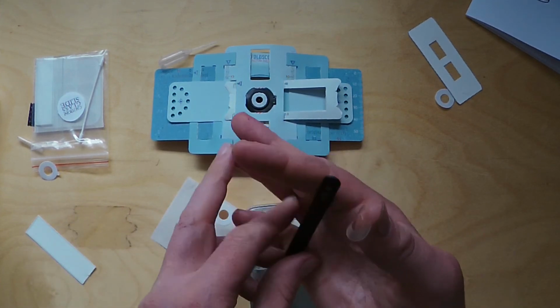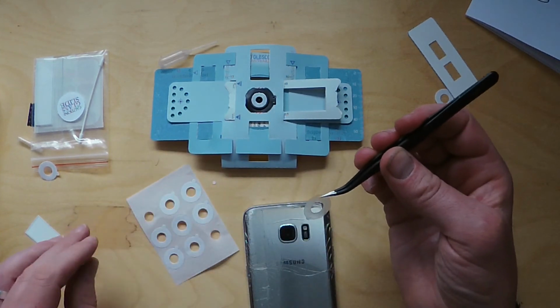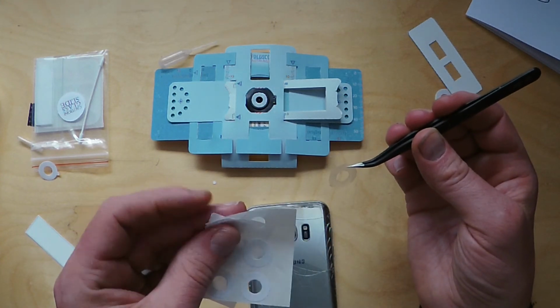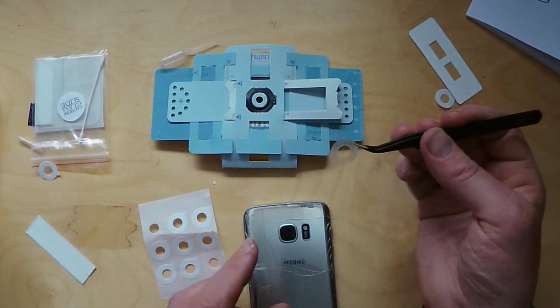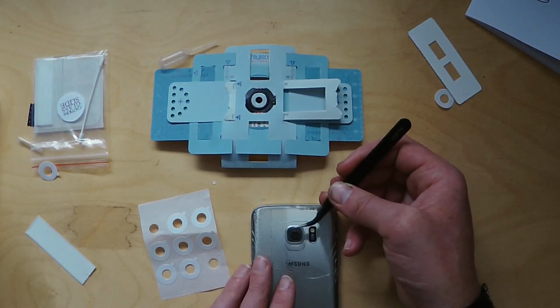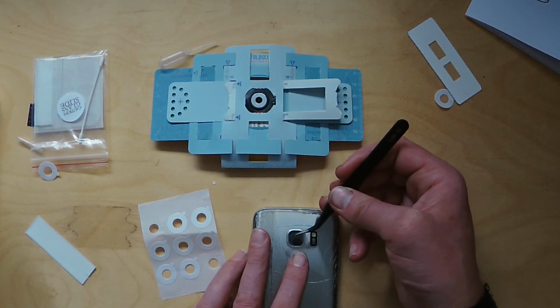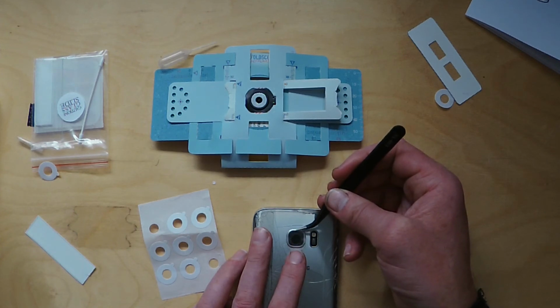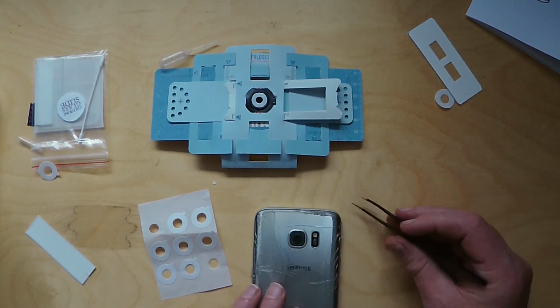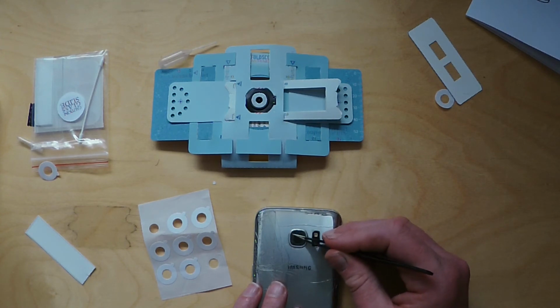Yeah, so obviously you need to take care when removing that sticker. Make sure that when you peel off this bit, you bring the sticky thing with you. Okay, so we've lost the sticky thing, but what you need to do is just place it as centrally as you can over the lens. And if you've got a phone with multiple lenses, find the main one, your main lens, or experiment with different lenses and stick that down there.